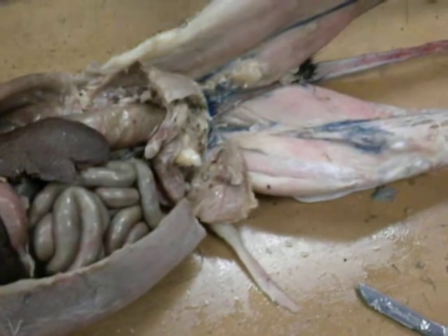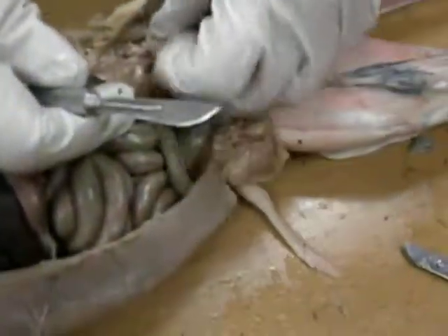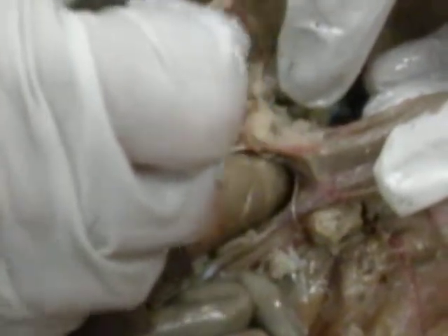And I can go back in. Okay, the rest of the urinary system, we have the urinary bladder. If you pull on this, you should see the two tubes. Both ureters kind of pop out from this. So here's one, and that goes all the way to the kidney. Here's the other one, and that goes all the way to the kidney. And then the urethra, you're trying to get to, all this right here. This is the tube down here that comes off the urinary bladder. It goes that way.